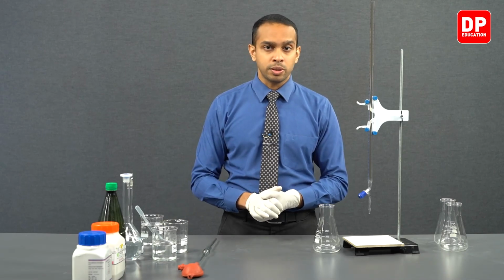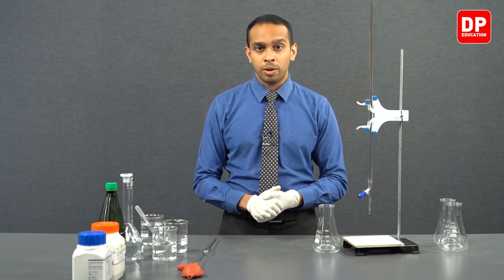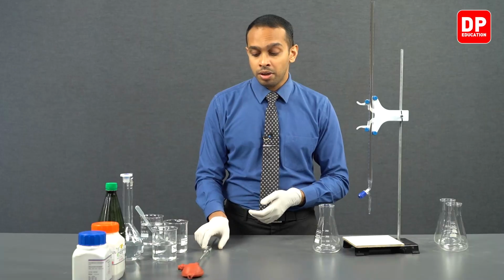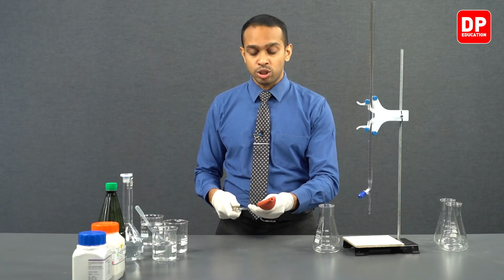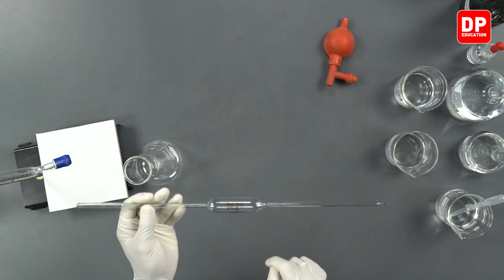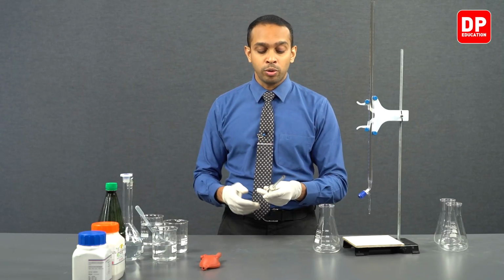After discarding the solution, you can take a new sample of this solution into the beaker. Otherwise, the water droplets present on the walls of your beaker might dilute the solution that we have prepared. So when it comes to handling any glassware, you have to wash it with distilled water first and then with the solution that you have prepared. Especially when it comes to this type of titration where we are trying to be as accurate as we can, we are going to always wash each of these glassware twice, once with distilled water and the second time with our solution that we are planning on taking into our glassware.